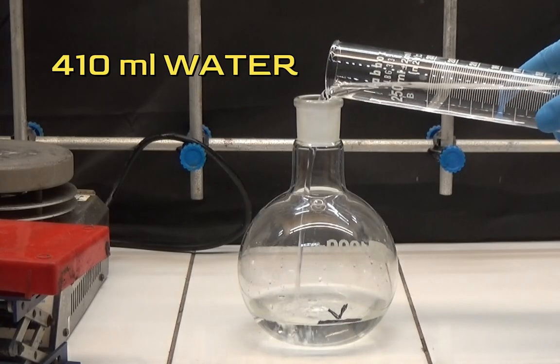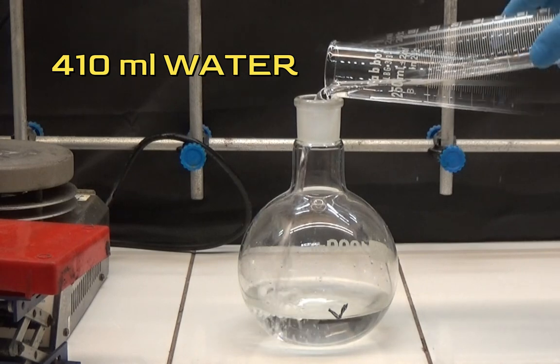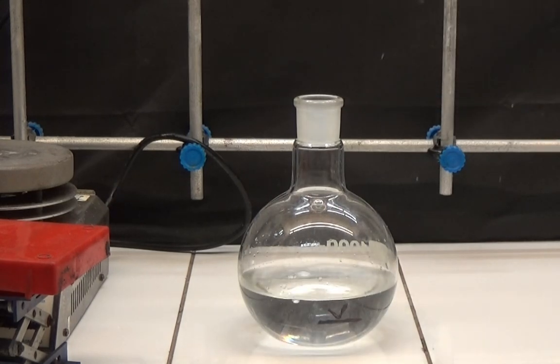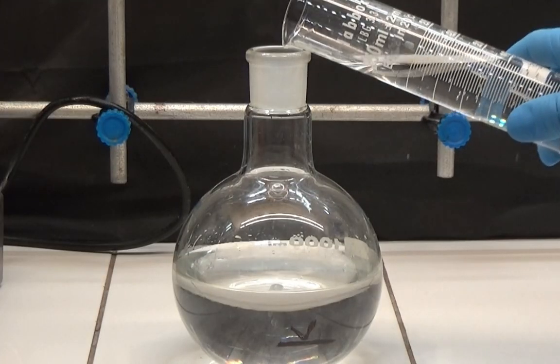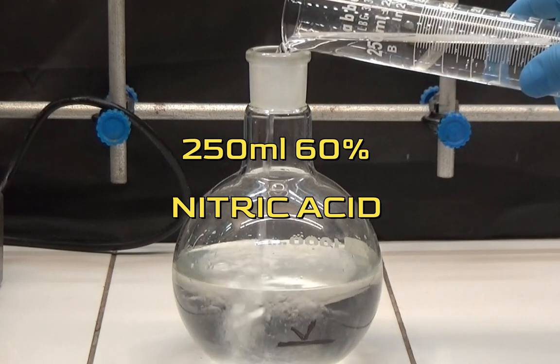Add 410ml of water. 250ml of 60% nitric acid will be added.